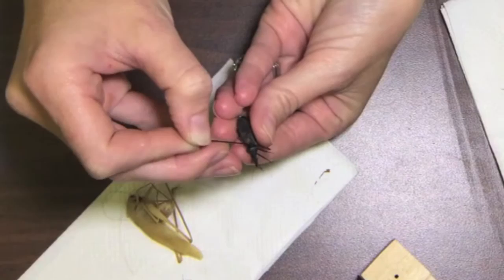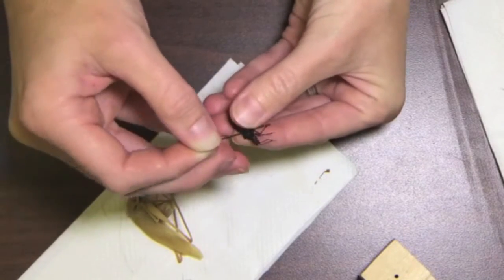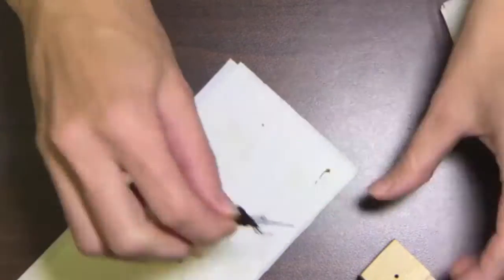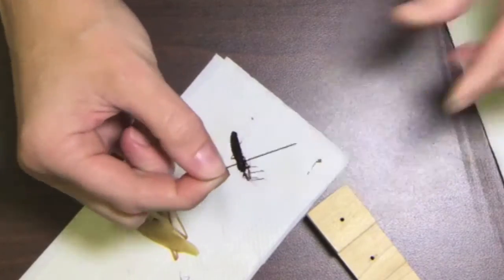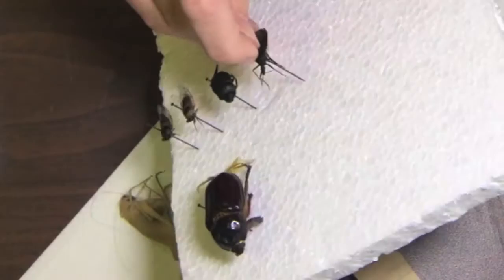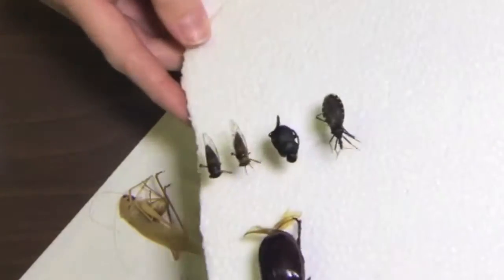This is a kissing bug — just to the right of the midline through the thorax. Push him through and make sure that he's nice and straight on the pin. Use the pinning block so he's the right height. When I set him in there you can see that they're all pretty uniform in height — one is not too far down, which makes the collection look more organized and consistent.